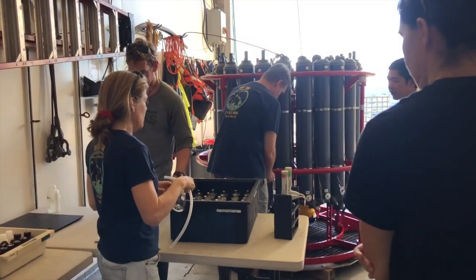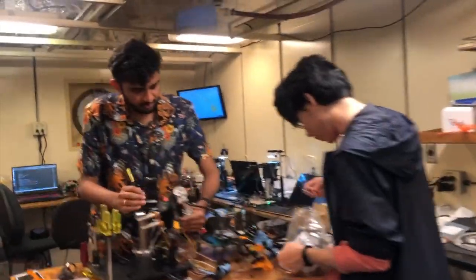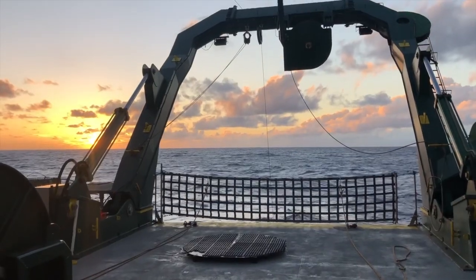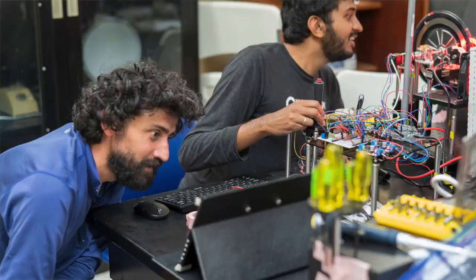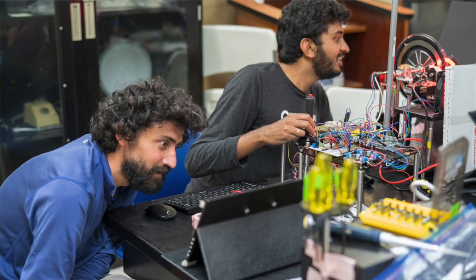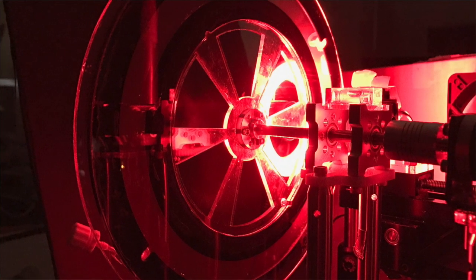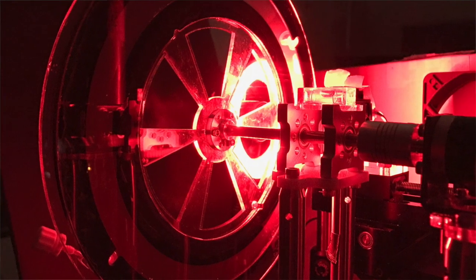We think quite a lot about putting ourselves in field contexts. Every field trip has taught us new things and brought new problems to the table. You have to be one with the problem you're trying to study. The way we have built and designed this instrument means that soon enough anybody will be able to take their regular microscopes, flip them 90 degrees, and mount this stage that performs this type of operation — to turn a traditional microscope into what we call a gravity machine.